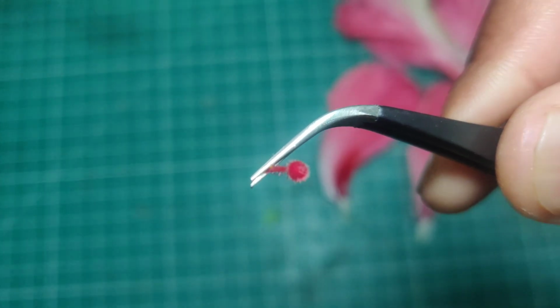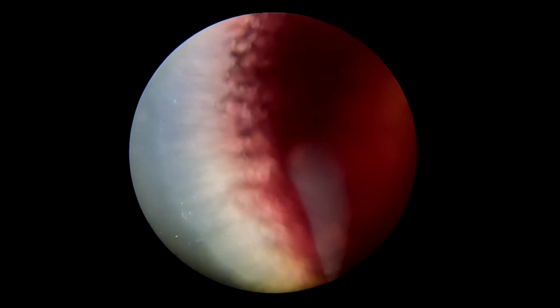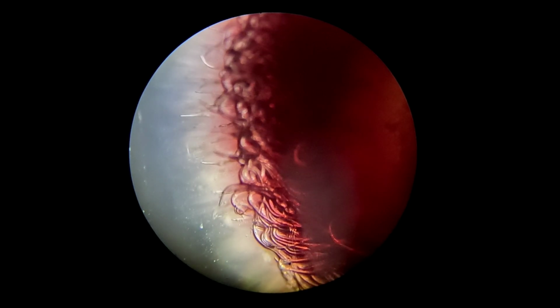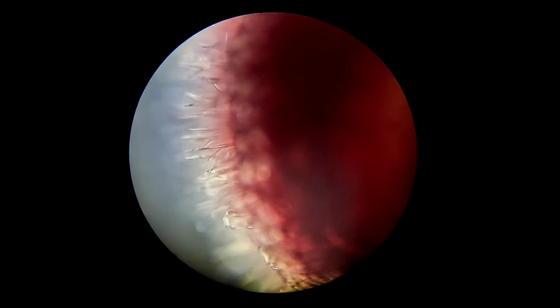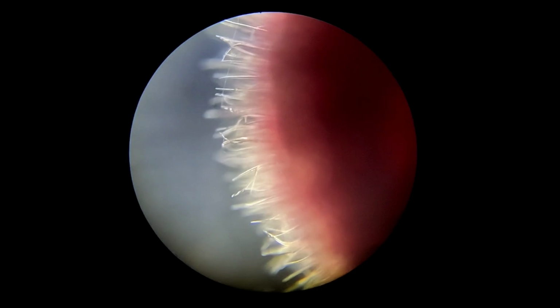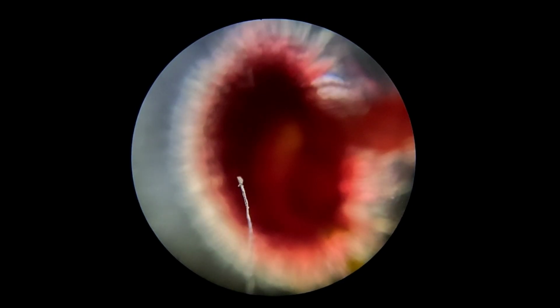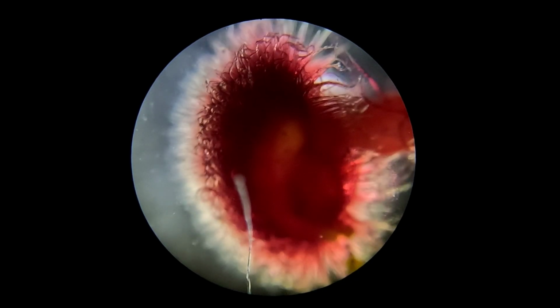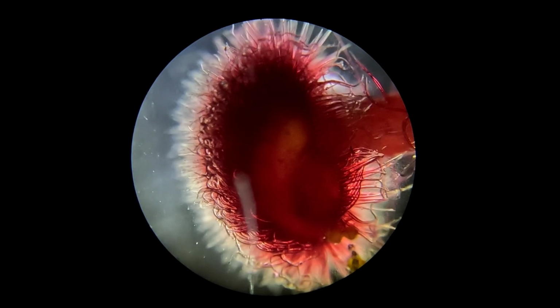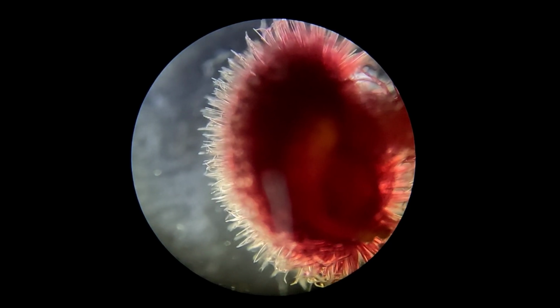Let's see how this looks under the microscope. This is the stigma under the microscope. Notice how uneven the surface is. You may see tiny knob-like or hair-like structures. More surface area means better pollen capture. Once pollen sticks here, it begins its journey down the style. This eventually leads to fertilization and seed formation. This is where life begins for the next generation. All of this happens quietly, without sound or movement.